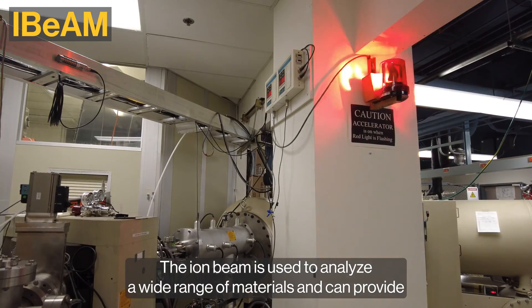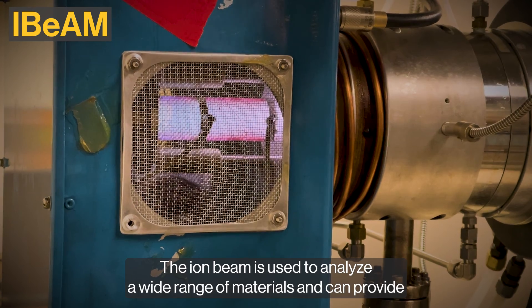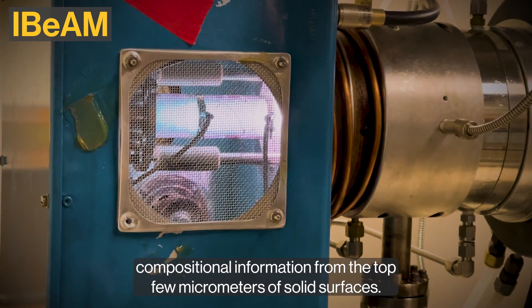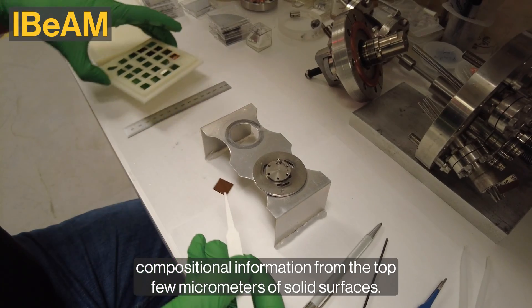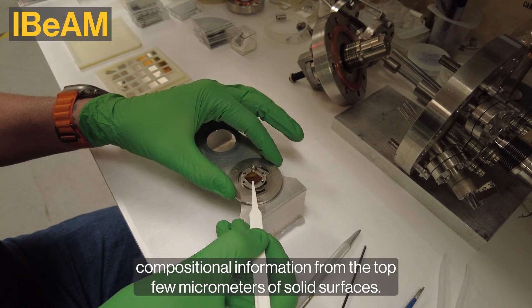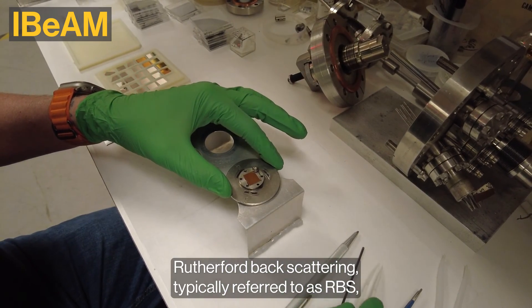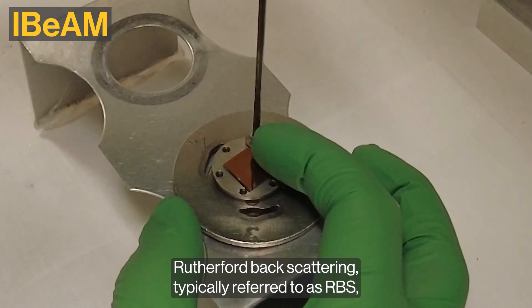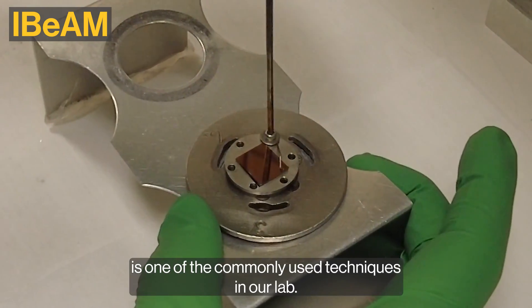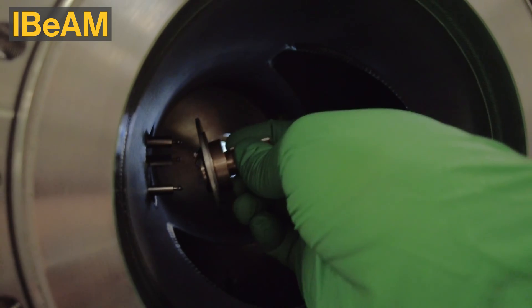The ion beam is used to analyze a wide range of materials and can provide compositional information from the top few micrometers of solid surfaces. Rutherford backscattering, typically referred to as RBS, is one of the commonly used techniques in our lab.